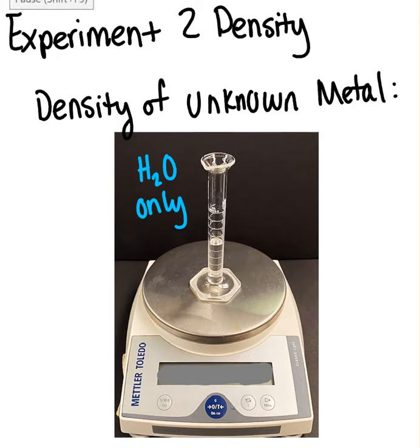This experiment is about density, and we're going to determine the density of an unknown metal, the density of water, and an unknown liquid as well. We're going to start with our metal, but to do the metal, we have to use water displacement to get the volume of the metal.